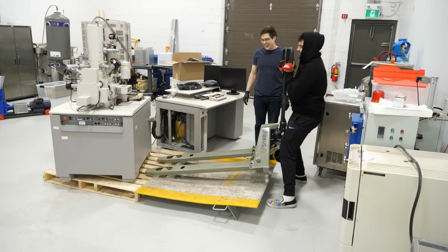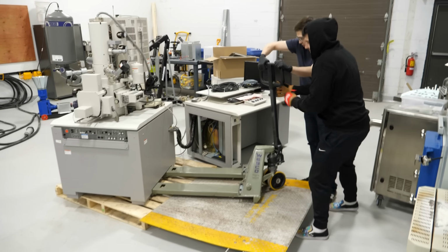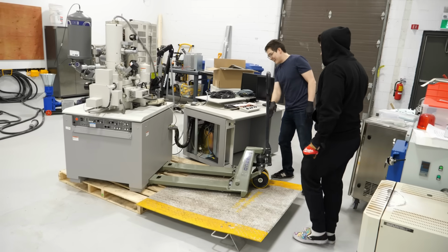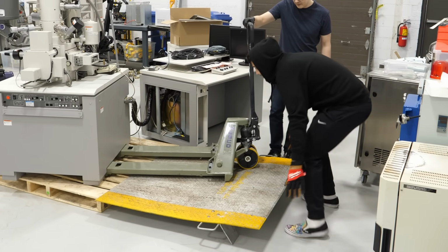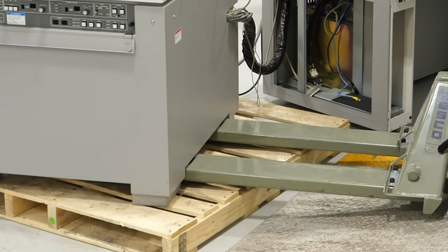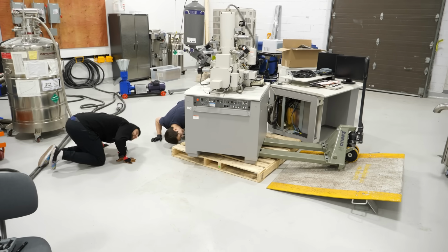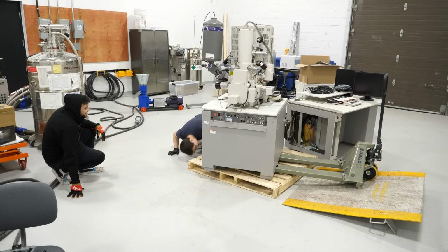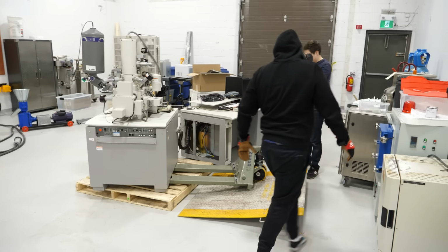I already hate this idea. I think you put it on there. No, it's at its peak. The problem now is the angle that the thing is on. It's really 21... Okay, wait, I have a better idea. Just hold it. I'm gonna pull it. You go in. Go! No, it's stuck on something. There's nuts and bolts sticking out. There's a singular screw coming out the bottom that is preventing it. So our plan got screwed up.